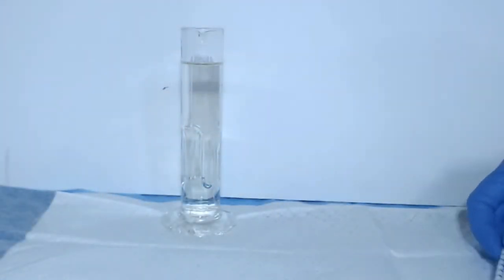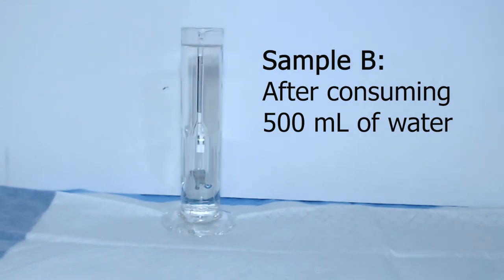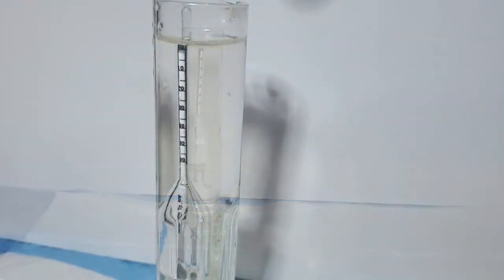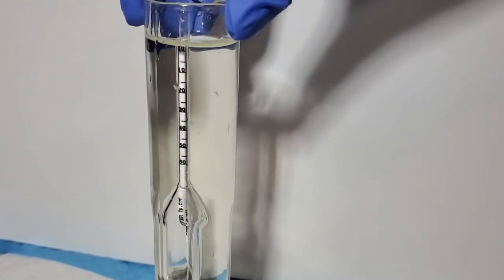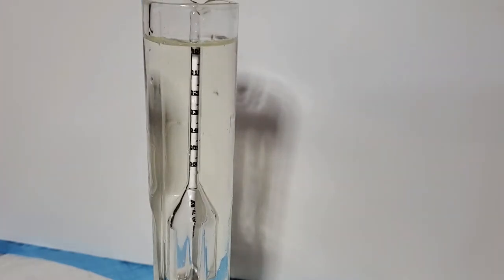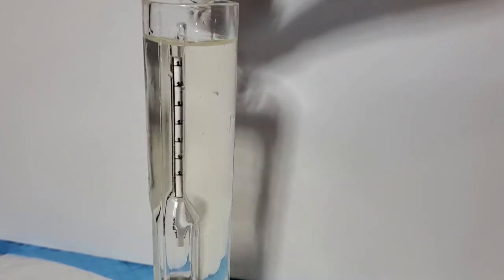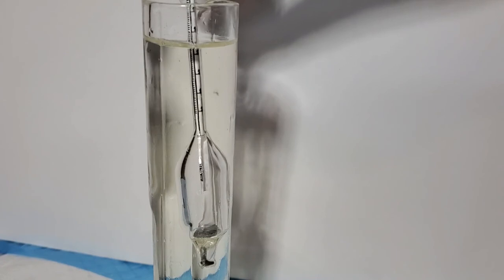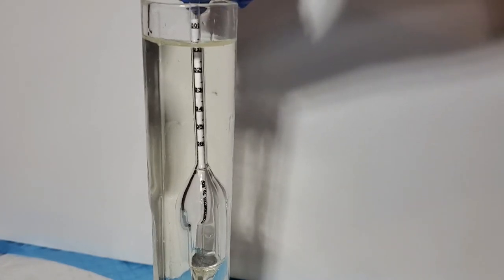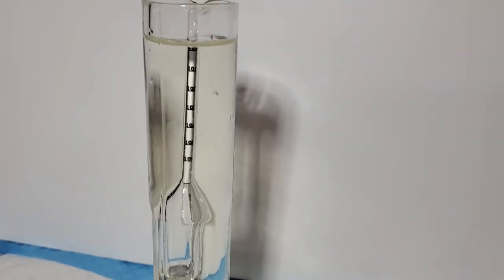And now you can find the specific gravity for sample B. Turn it so you can get a better look. Go ahead and make a note of those two specific gravities.